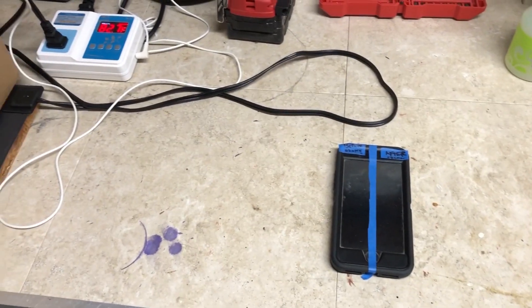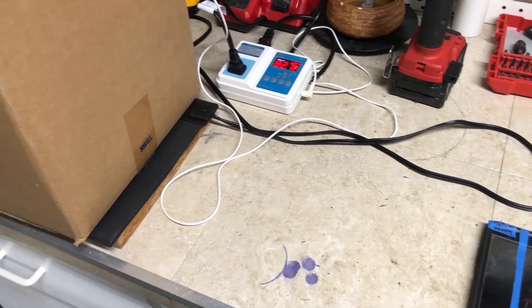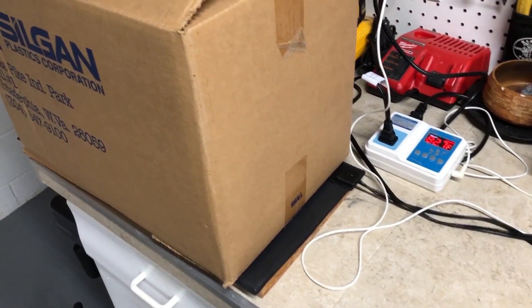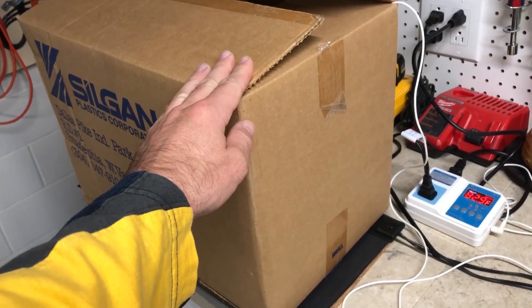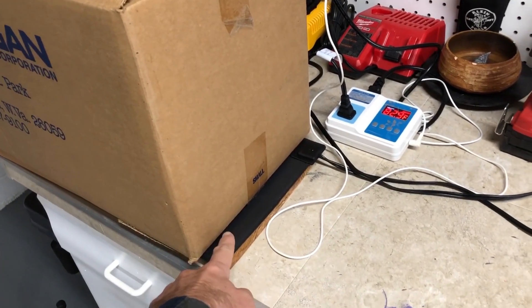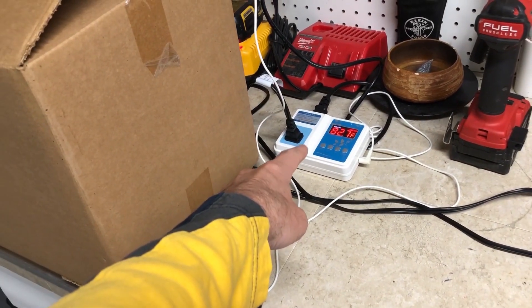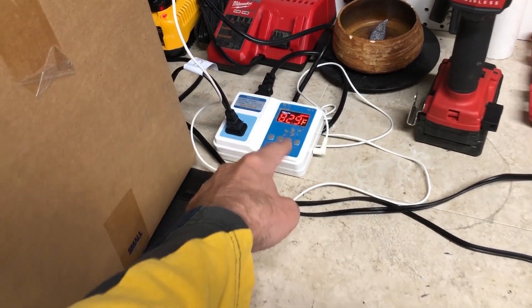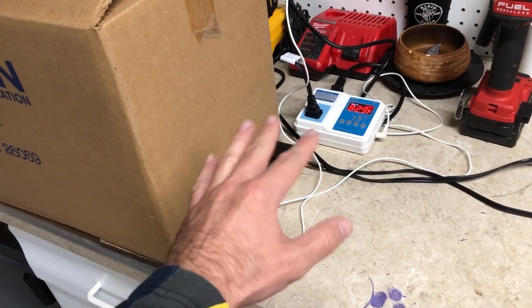While we're waiting for that bread experiment to finish up — it's been two weeks already and not a lot is happening — I figured I would go ahead and do something maybe a little more definitive. What I have here is an incubation chamber. It's literally just a box with a rack inside, some petri dishes, a heat mat mostly for gardening, and an inline thermostat. I've been keeping this at about 90 degrees and it's working out very well to keep a stable temperature.